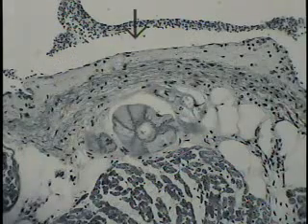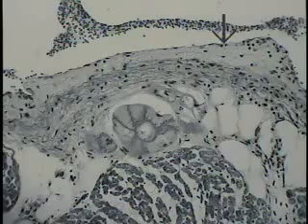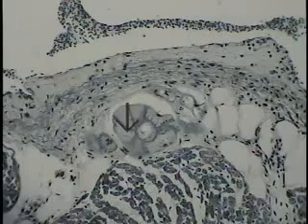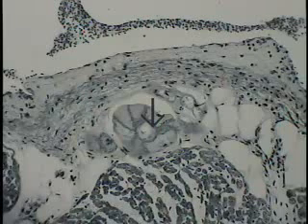So this again is endocardium. The endothelial lining can be seen at the tip of the pointer. This residual spotty type of material are erythrocytes that have been stained black with this particular stain. It's quite common to find within the endocardium adipose cells, or these white fat cells. This is typical myocardial or cardiac muscle cells of the myocardium here. These are the Purkinje cells. There are 1, 2, 3, 4, 5, perhaps 6 of these very, very large conducting cells.